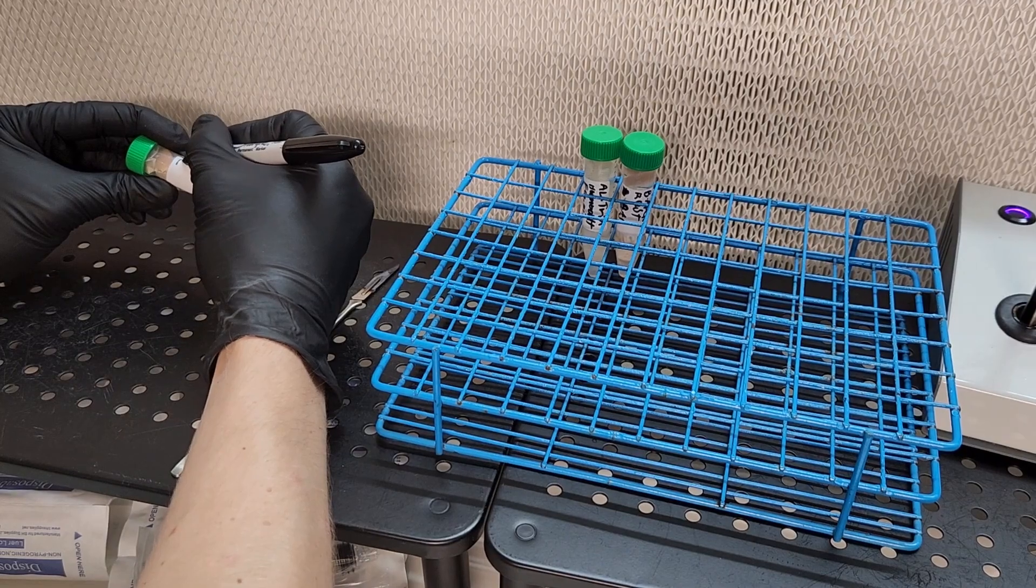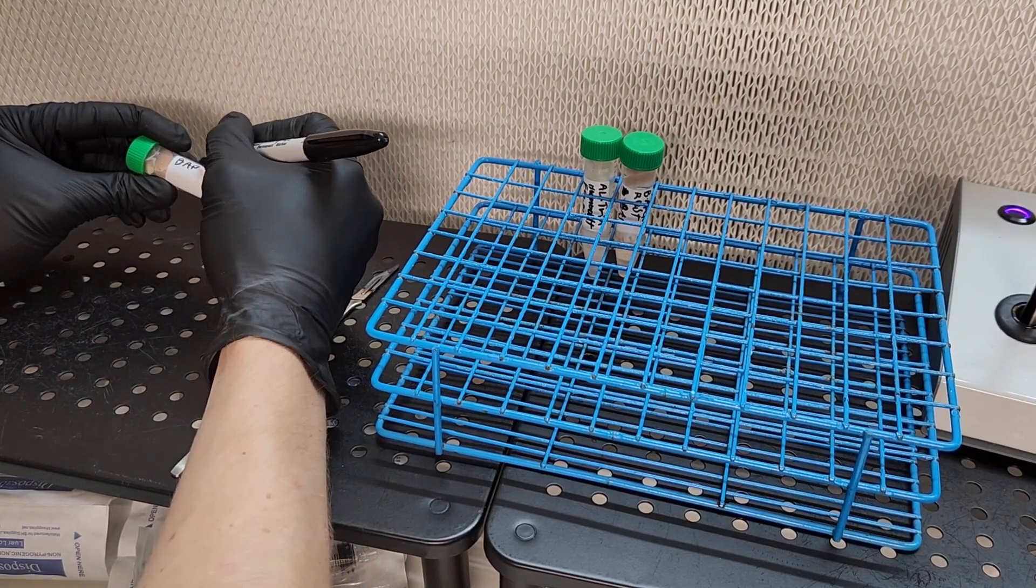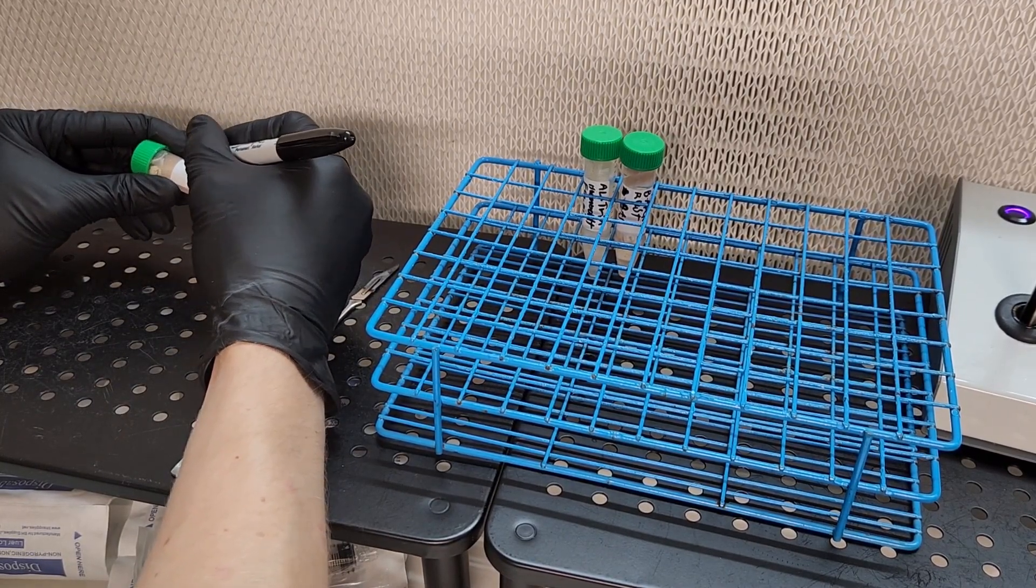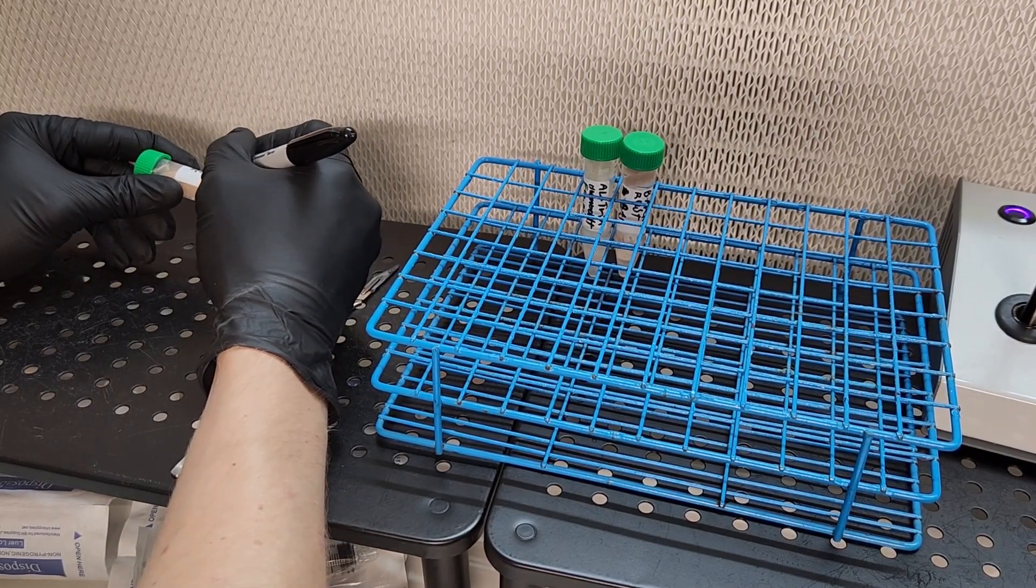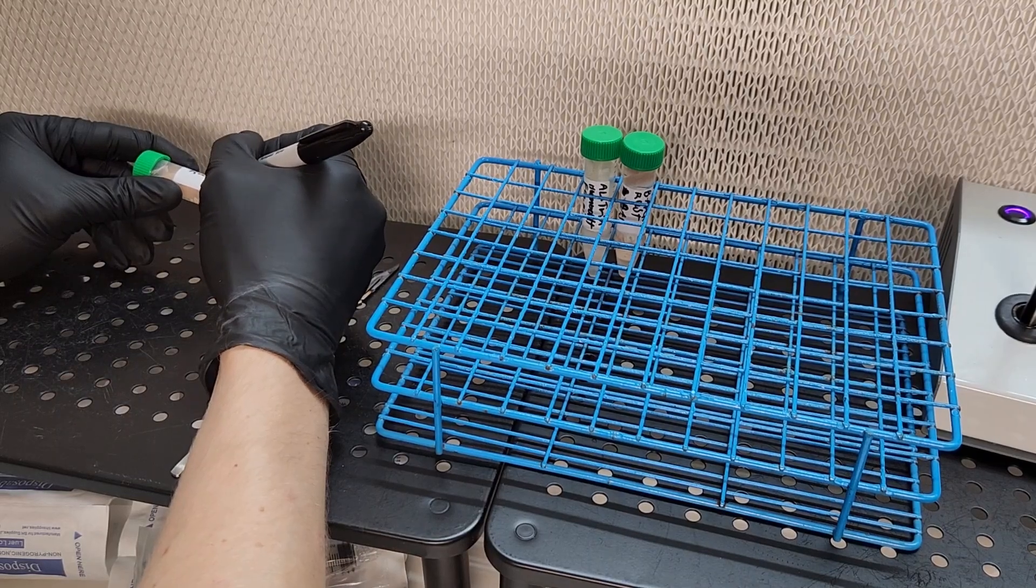Label it up. I put strain name, I like to label the spore generation and the clone generation, and then I put a date.